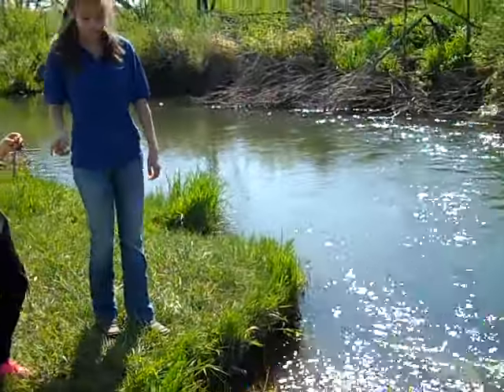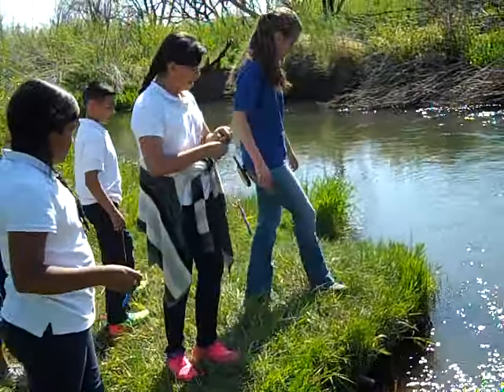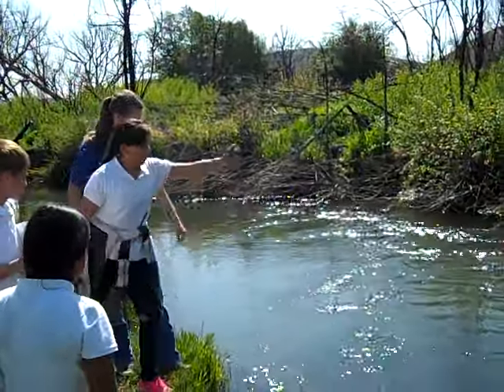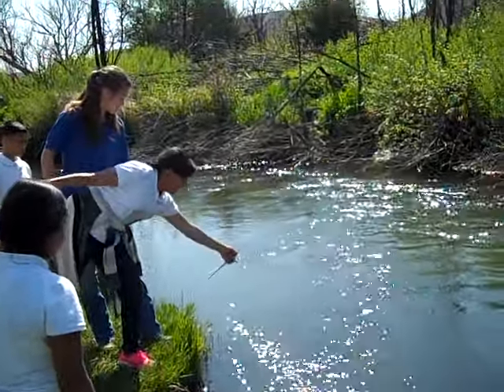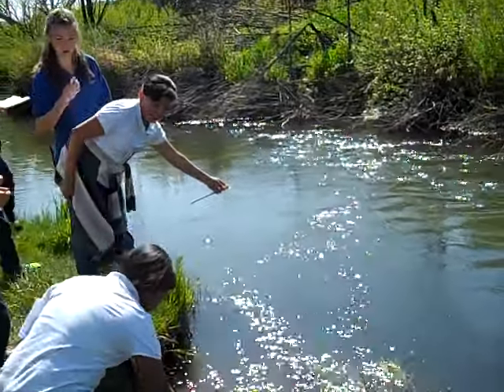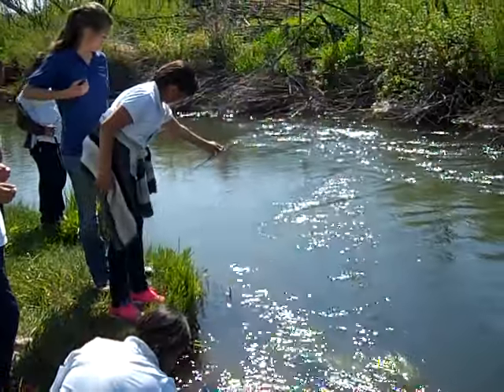So you're going to try and just kind of toss it out there. Try to get it out there as far as you can. It's kind of hard. And then you can just take it right there, the slower part. Keep it in there for a little bit.